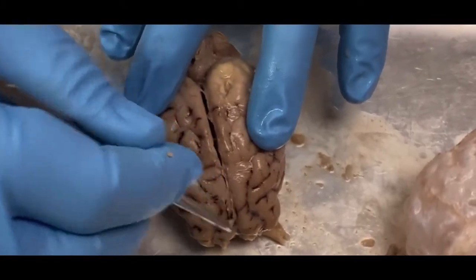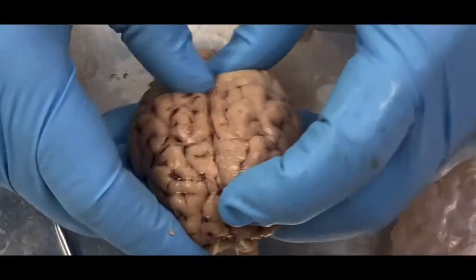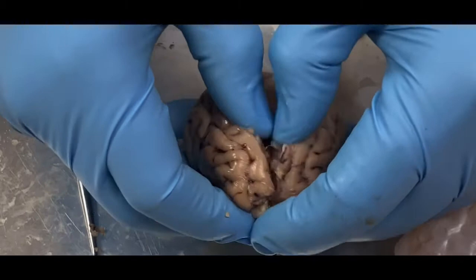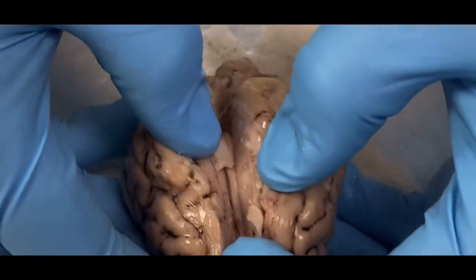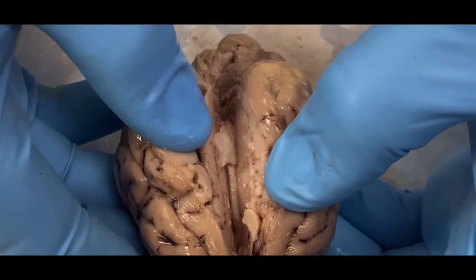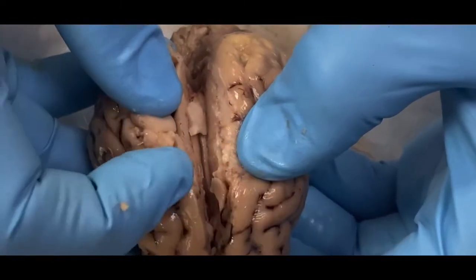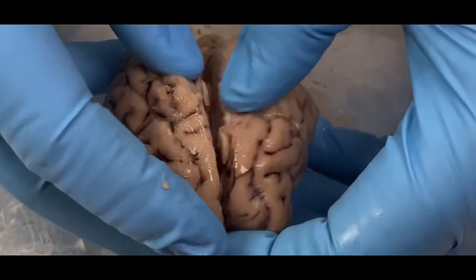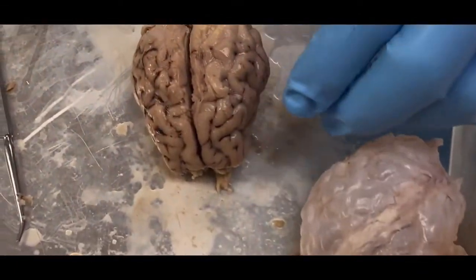And I'm just going to cut some more of this out in there. And now I'm going to gradually open this up, and what we should see, if we look at this white thing at the bottom, is there's like a white shiny line at the bottom there. That's basically my corpus callosum right there. The corpus callosum is responsible for helping the right side of the brain send information to the left and vice versa. Okay, so let's go ahead now. We're going to cut the brain in half.